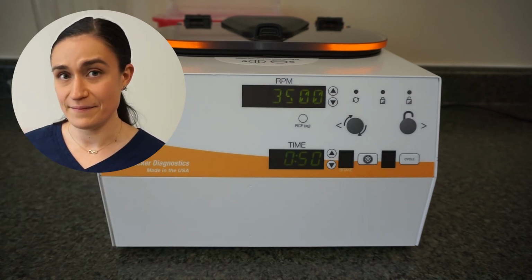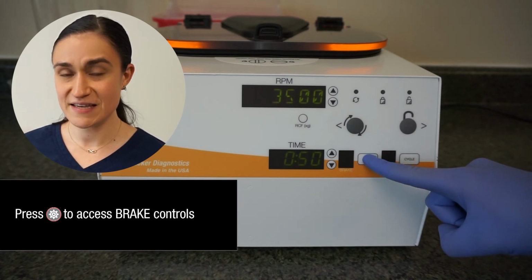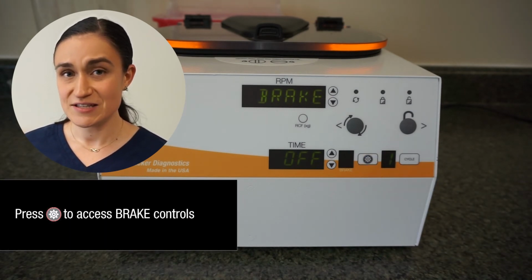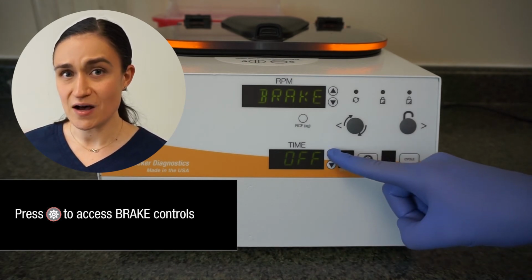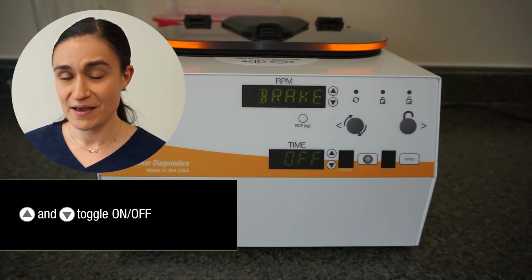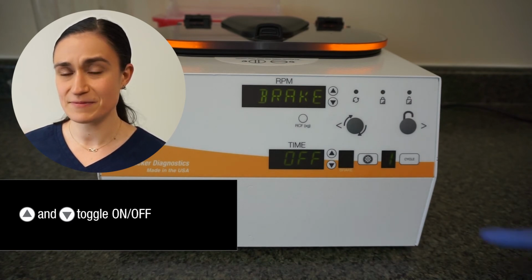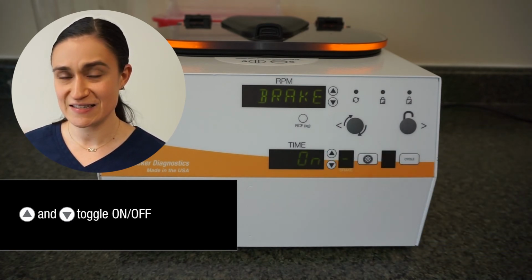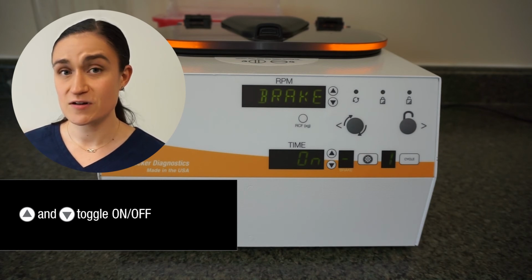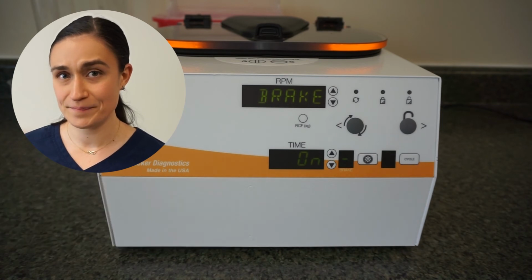Once I've got my RPM and time values the way that I want them, I'm going to press the menu button to enter the advanced menu. As you can see, brake is now displayed on the RPM screen, and the words off and on can be displayed in the time screen by using the up and down buttons next to it. So right now, my brake is off. To turn it on, I'm simply going to use the up button next to the time screen. The words on are now displayed on the time screen, meaning that my brake is on.